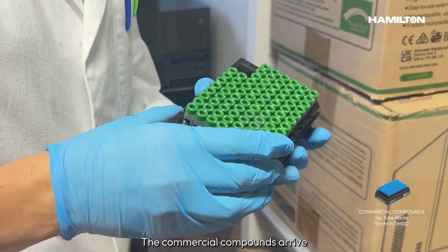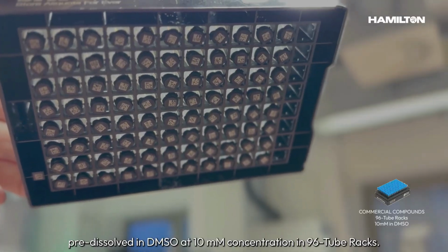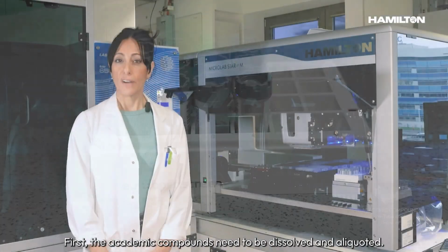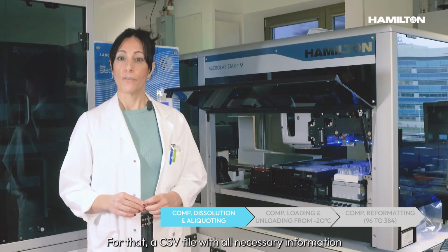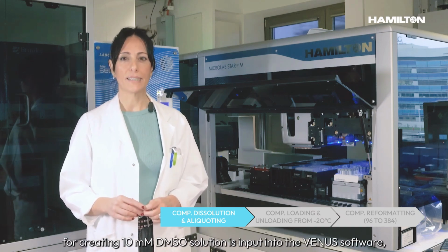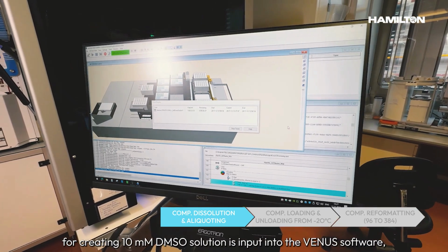The commercial compounds arrive dissolved in DMSO at 10 millimolar concentration in 96 tube racks. The academic compounds come as powder in 24 tube racks. First, the academic compounds need to be dissolved and aliquoted. For that, a CSV file with all necessary information for creating 10 millimolar DMSO solution is input into the Venus software, which controls the system.